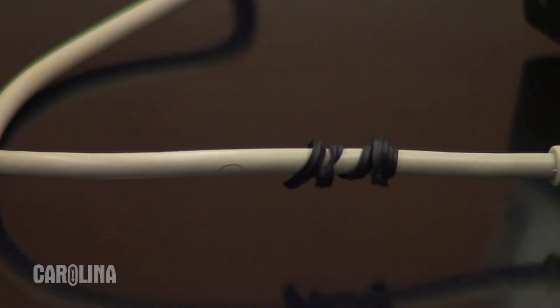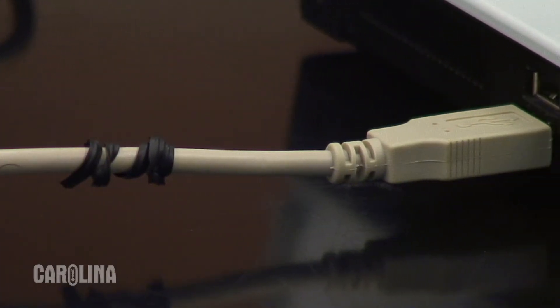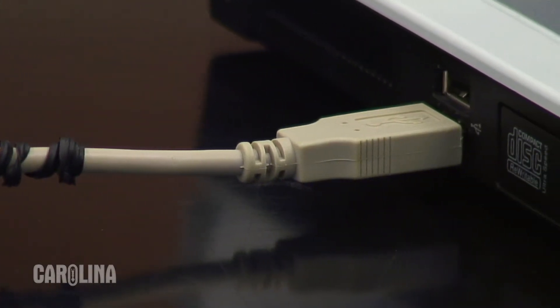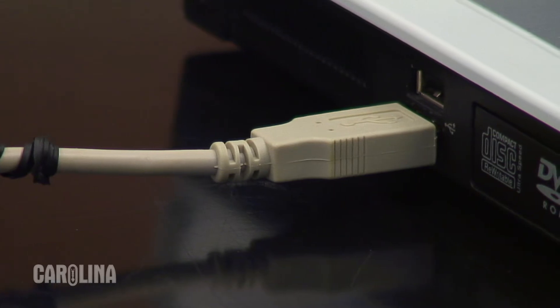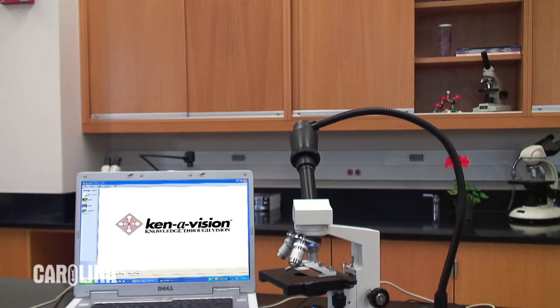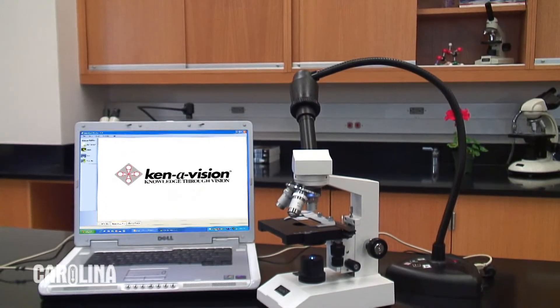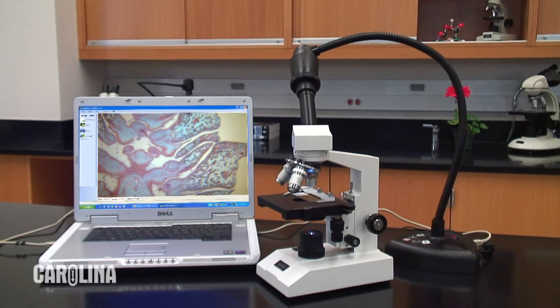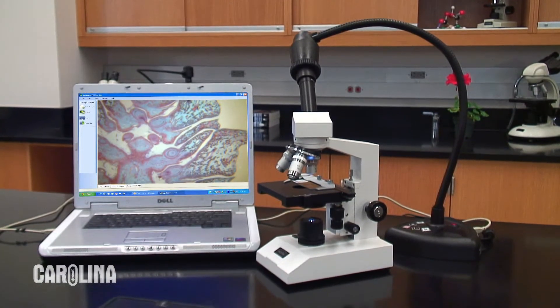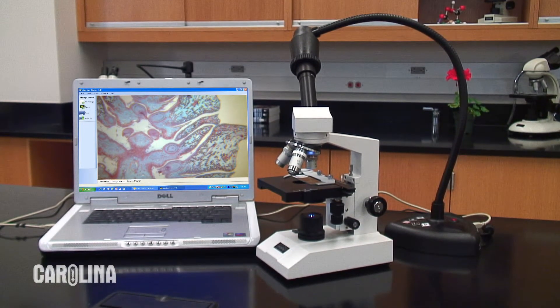This lets you run a live video signal to a TV or projector and record images on your computer at the same time. You can view live video, edit captured images, create time-lapse studies, or record movies with the included software.